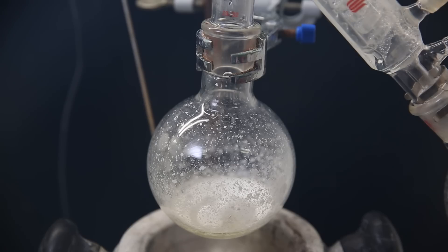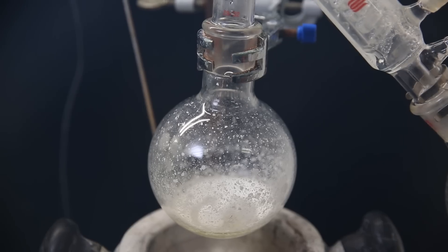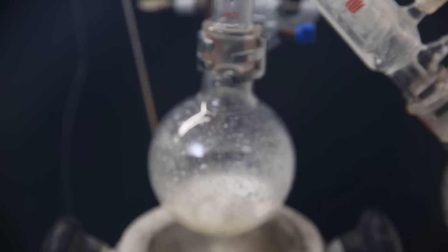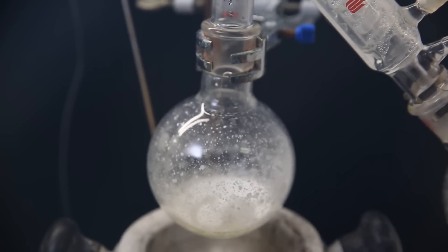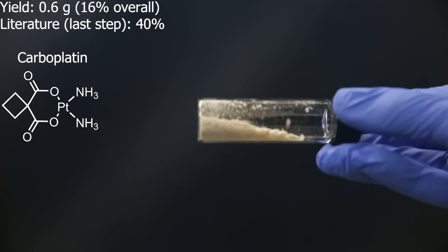What is left behind contains mostly carboplatin. I washed it with cold water, then with ethanol, and then ether, to remove any remaining salts and acid. But I guess my camera didn't record that. Either way, it wasn't too exciting. And I then moved all that I could get out to a vial.